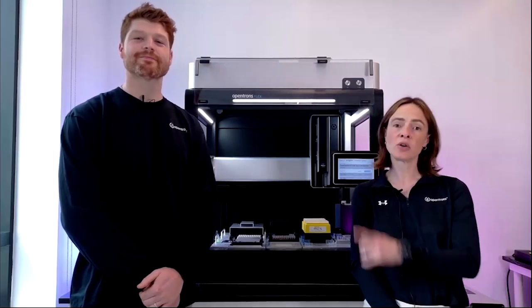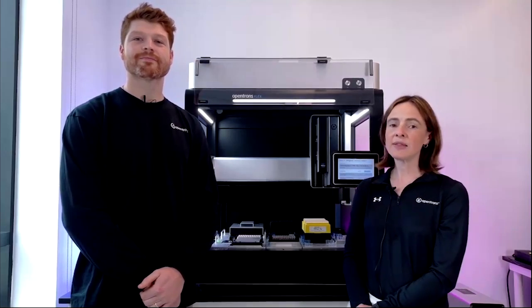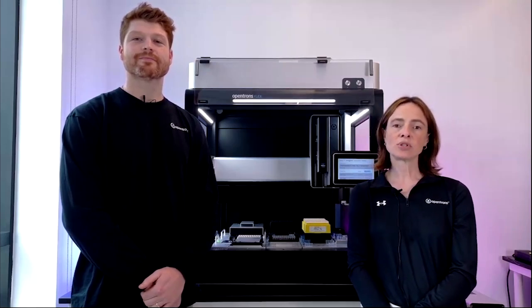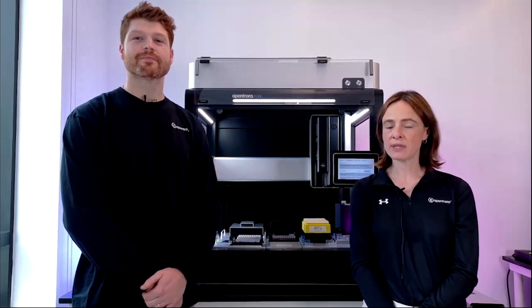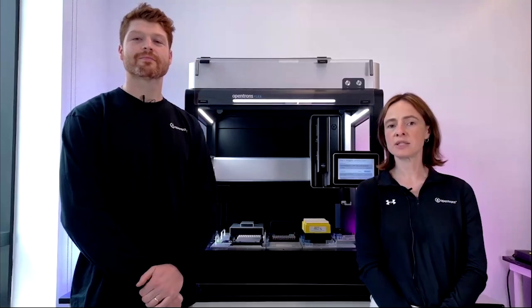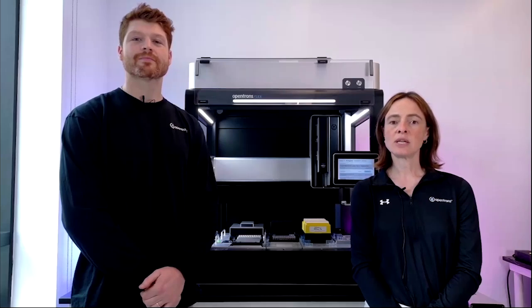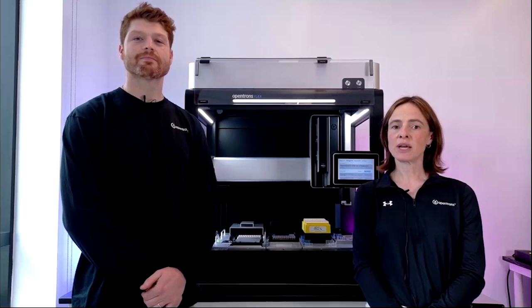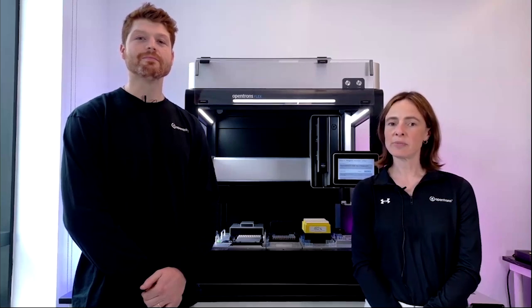So today we'll show you the Opentrons Flex, and we'll talk through some key features such as the pipettes and the modules. We'll talk about a new hardware accessory that we have up here and some new software functionality. And then Nick will take you through a demo automating a workflow on the Flex using a protocol downloaded from the Opentrons protocol library. This is a very easy process to get existing protocols, some of which have been verified by our scientists or reagent partners, to run on your robot. And we'll show you how to alter key parameters such as sample number from run to run. And then finally, we'll answer any questions you may have at the end of the demo.